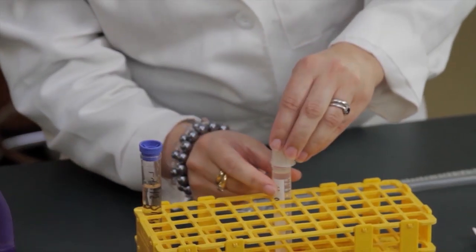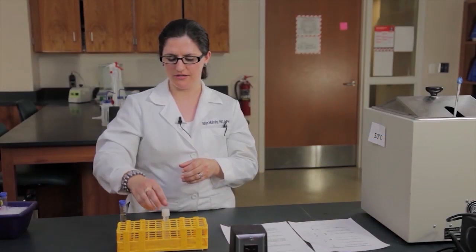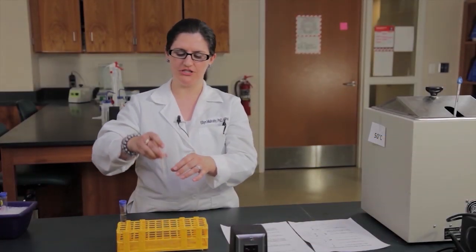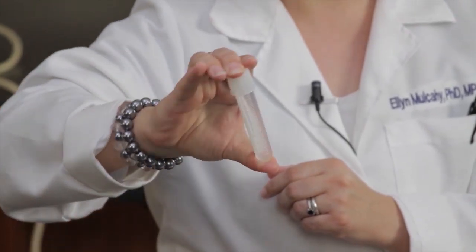So we'll leave that extraction sit for five minutes undisturbed. So we've allowed our extraction to sit with the alcohol for five minutes. What I'm going to do now is I'm going to slowly invert my tube so that the alcohol layer mixes with the aqueous layer.